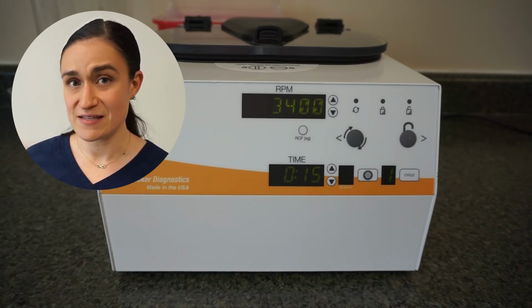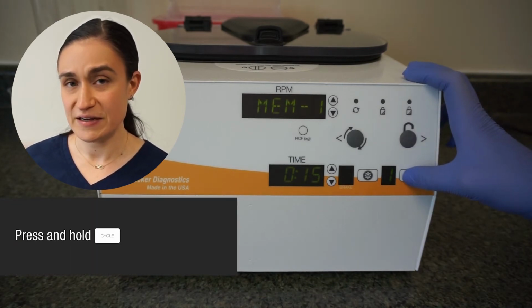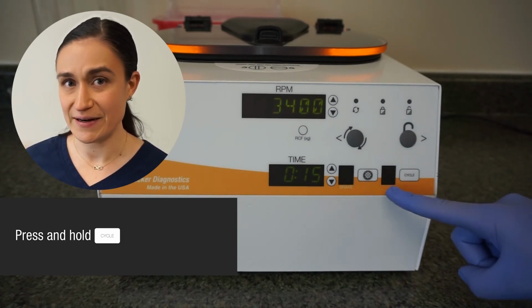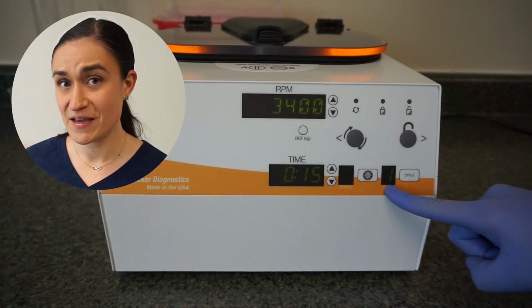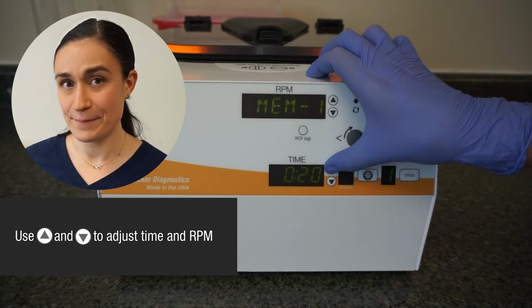Once we have our correct cycle selected, we're going to press and hold the cycle button. You'll hear the centrifuge beep, and the number next to that cycle button will start flashing. That's how you know you're in edit mode. This is where we change our time and our RPM.